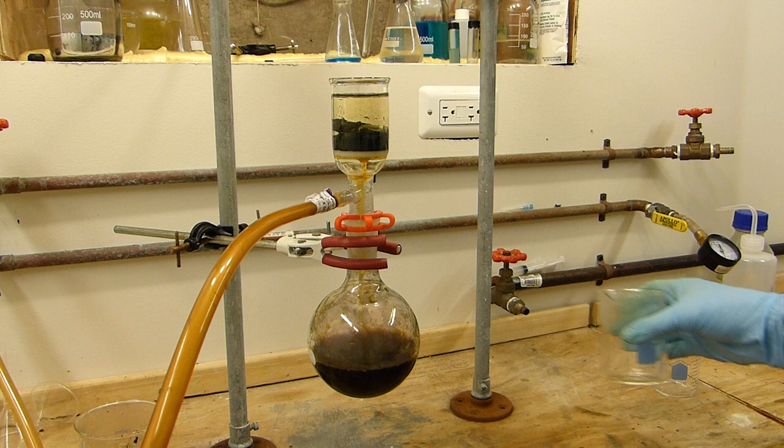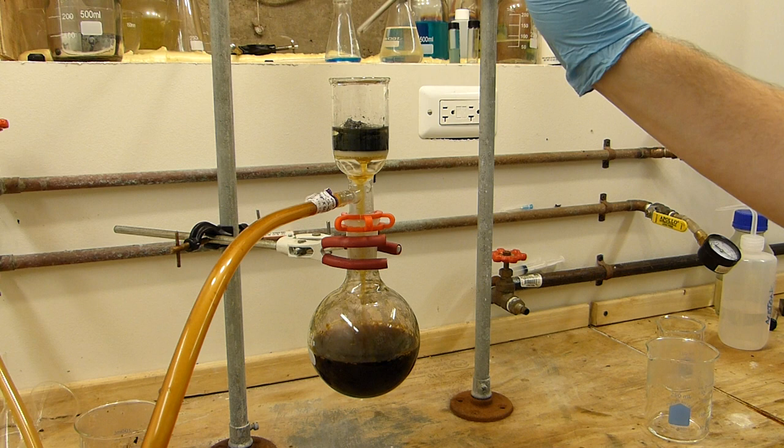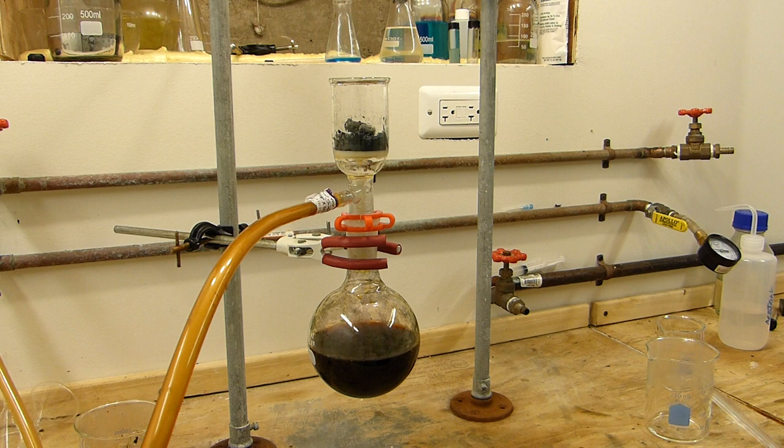And we'll just fill this up and pull the rest of this cold water through. This will effectively clear this of the remaining acid as well as any unreacted potassium iodide.